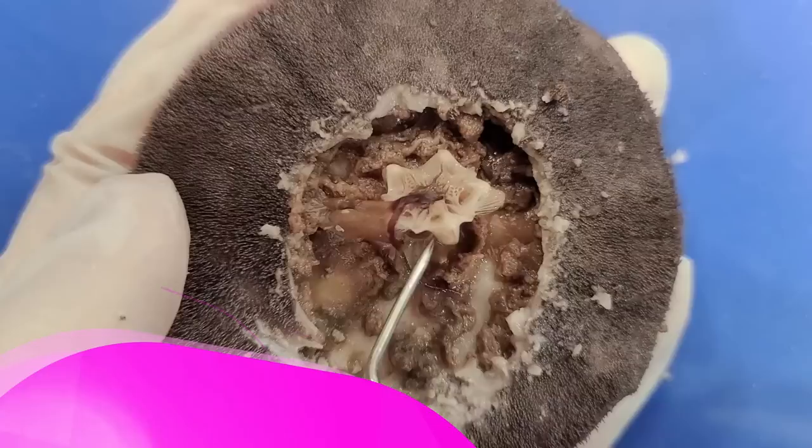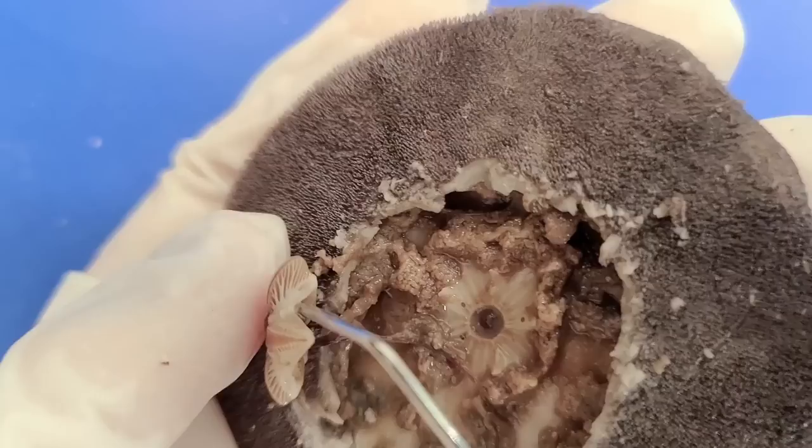Now let's take a closer look at Aristotle's lantern. If I take it out, we'll be able to see the five teeth embedded in the lantern. I'll put a picture up of what the individual teeth look like.